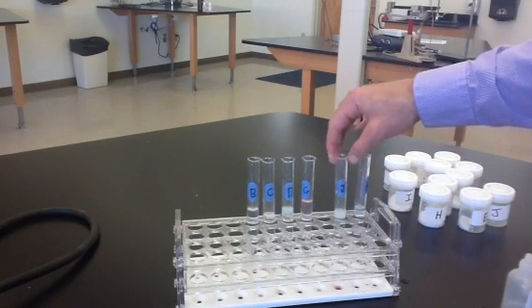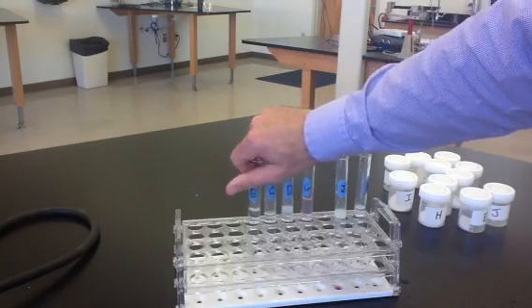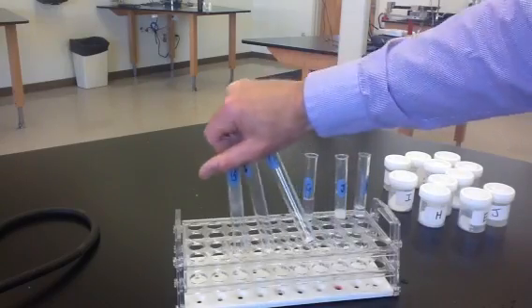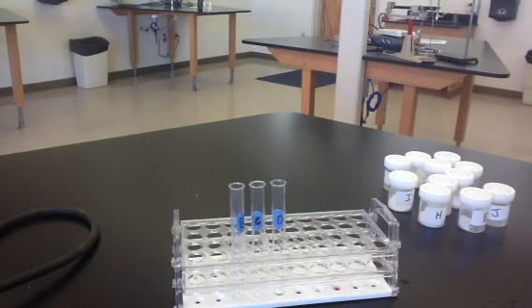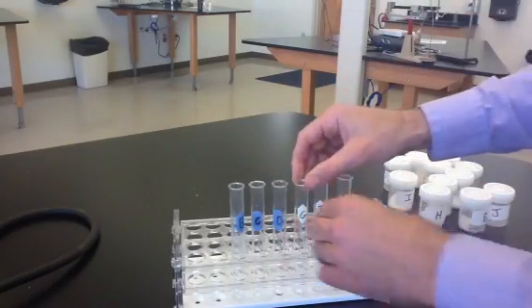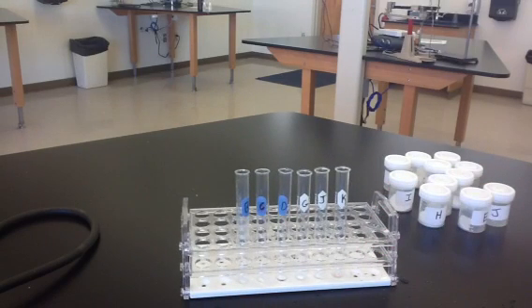All right, so our remaining solutions to be identified. We're going to get fresh samples of these. So we have samples B, C, and D. So here's a fresh sample of B, C, and D. And then we're also going to get a fresh sample of G, J, and K. So here's a fresh sample of G, J, and K, the substances that we have not yet identified. So those are just fresh samples that have not been dissolved in water yet.